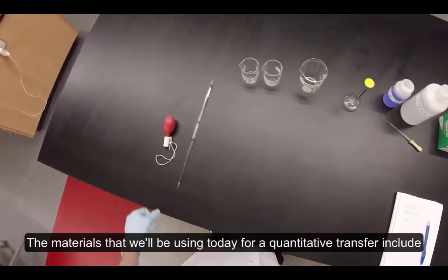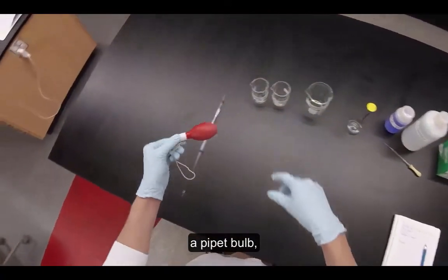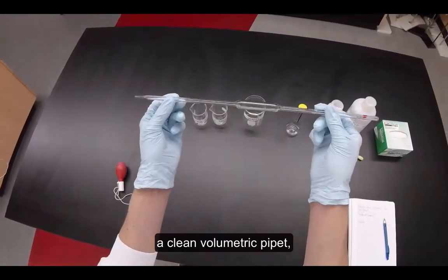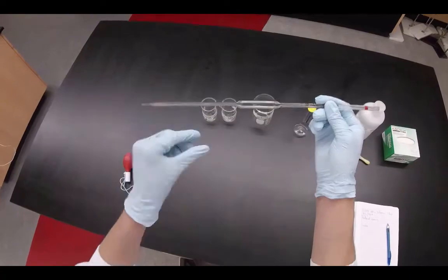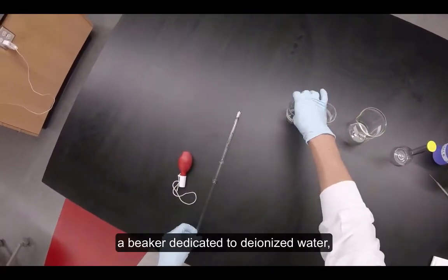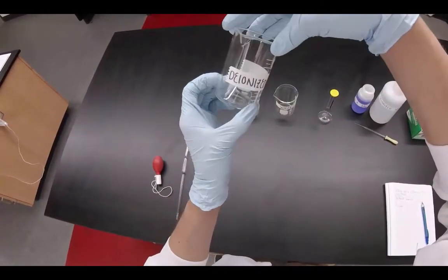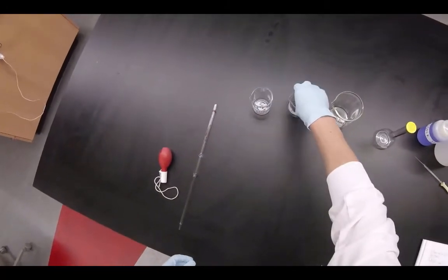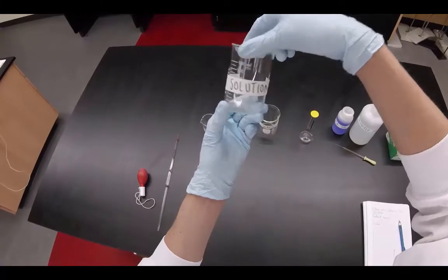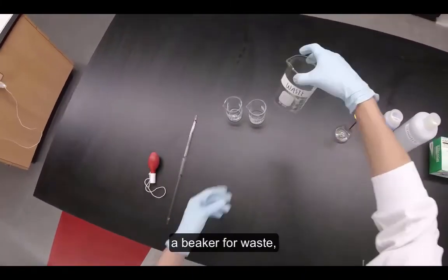The materials that we'll be using today for quantitative transfer include a pipette bulb, a clean volumetric pipette, a beaker dedicated to deionized water, a beaker for your stock solution, and a beaker for waste.